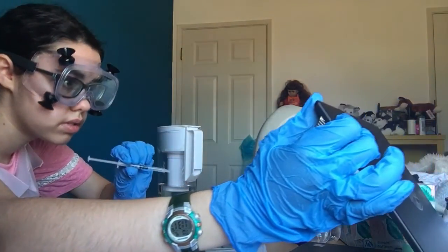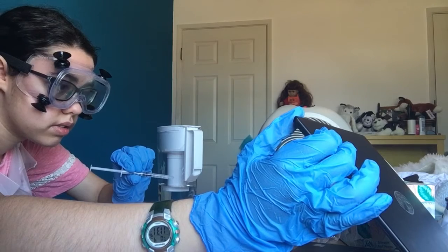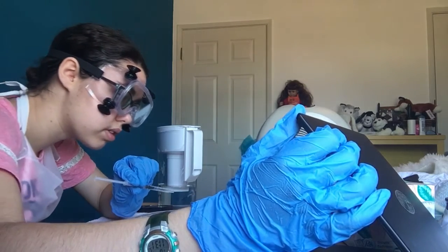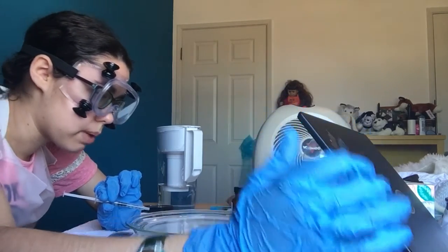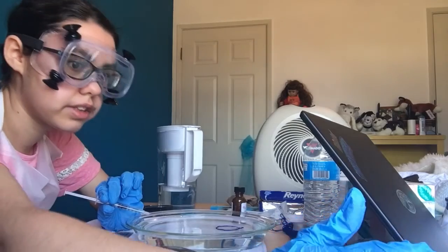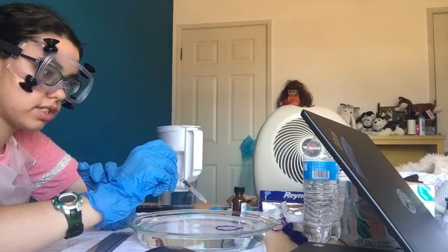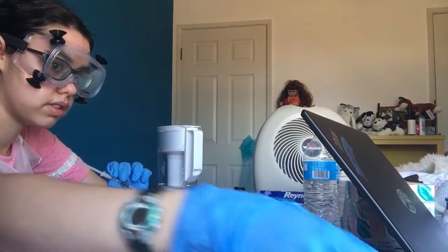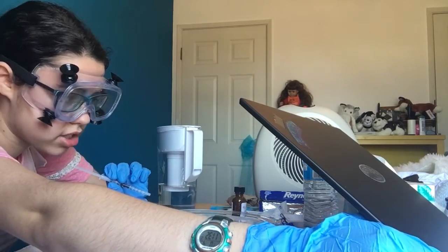Okay, so then you're gonna let it evaporate for a little bit, and then if you put another drop of stearic acid and it doesn't disappear, it takes a long time for it to disappear, then you completed the monolayer. Yeah, the last drop I put in is just about disappearing. Okay. So yeah, that's the circle it is. I'd say that's a good circle.